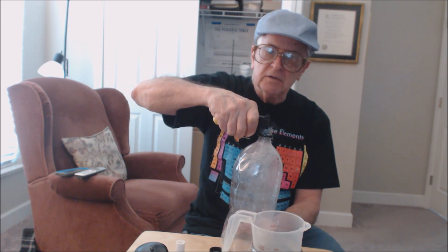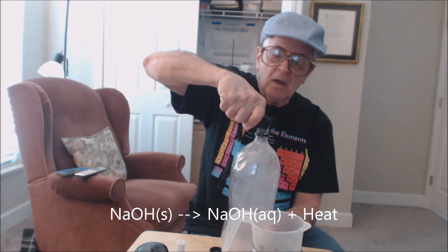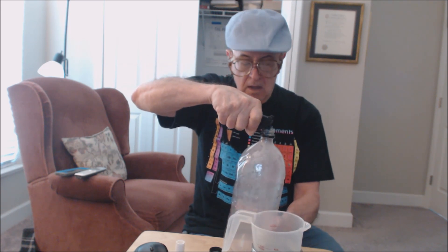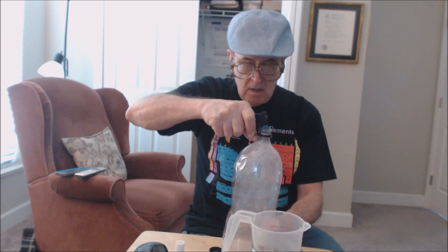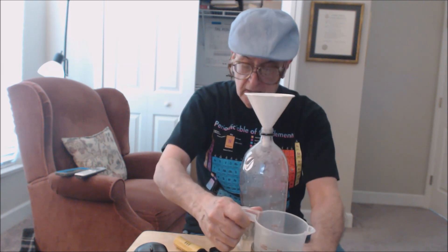Now I have about 200 milliliters of water with five grams — one teaspoon full — of lye, which is sodium hydroxide, which I got at a hardware store. Now let's carefully add the 250 milliliters of lye solution.